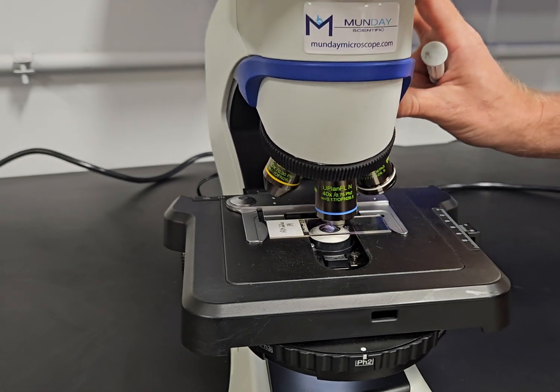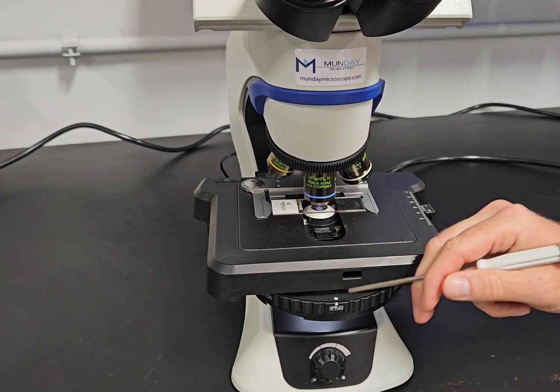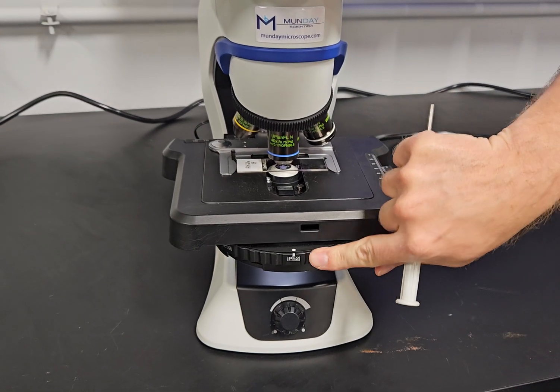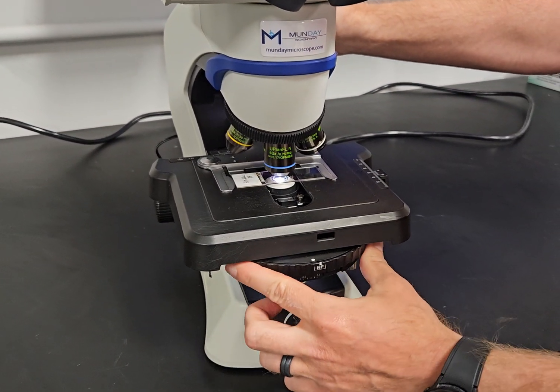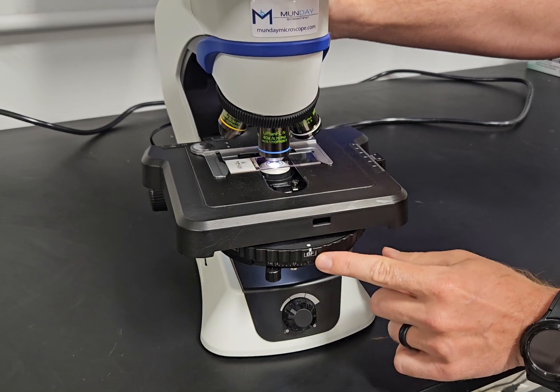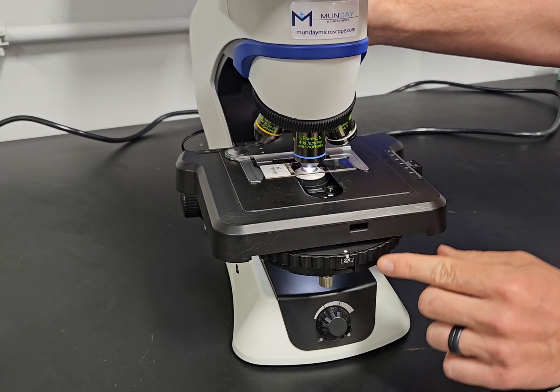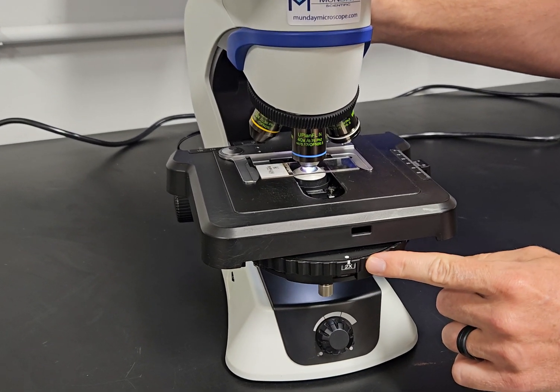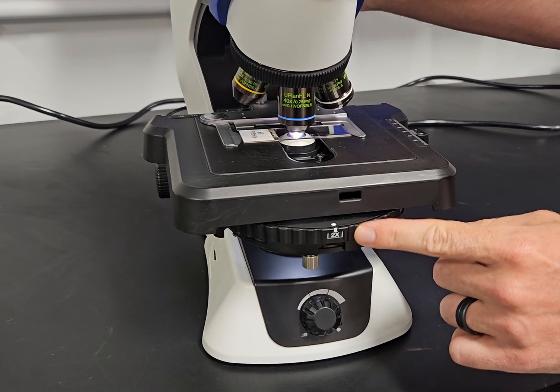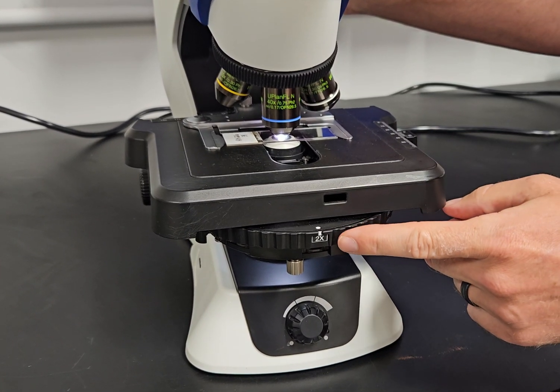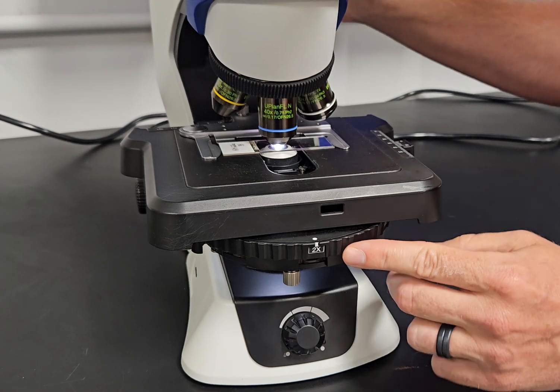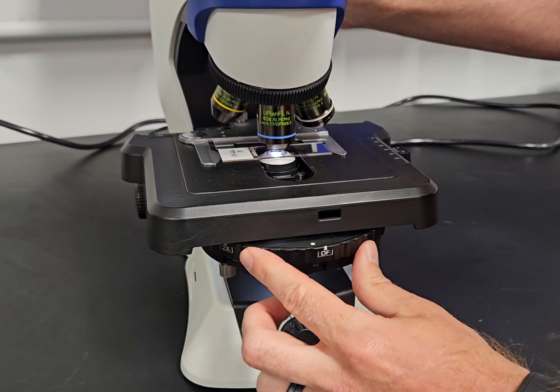That's very important because we're going to step down here to the condenser, and this condenser on these CX is pretty cool. It has a lot of built-in stops. We have a standard bright field stop, a 2x stop if you wanted to put a 2x on this and fill the field. If you didn't have this stop in and a 2x objective lens, the field would not be completely full. That's a really sweet feature on this scope.